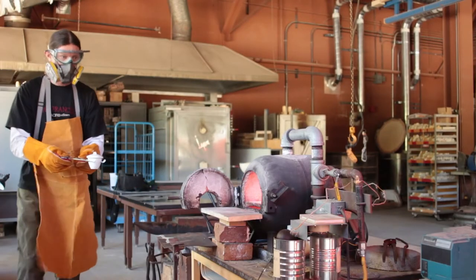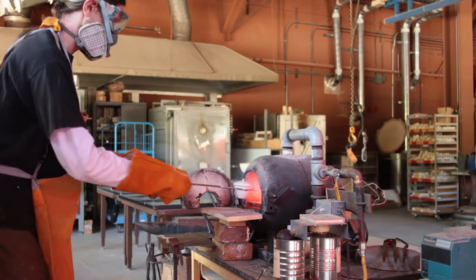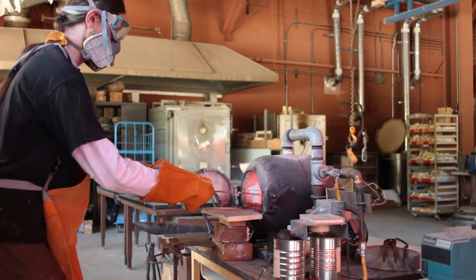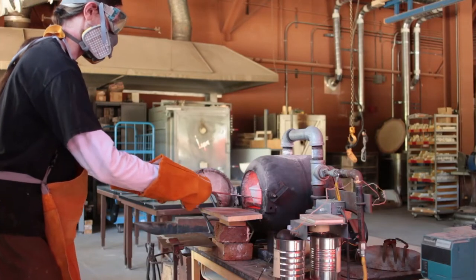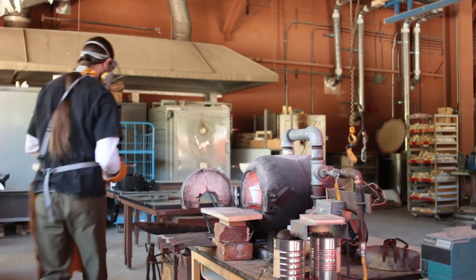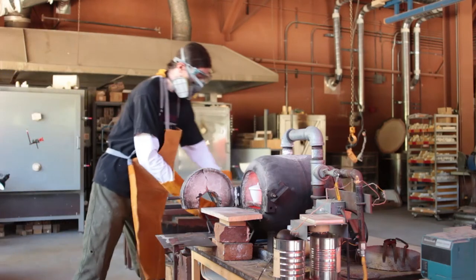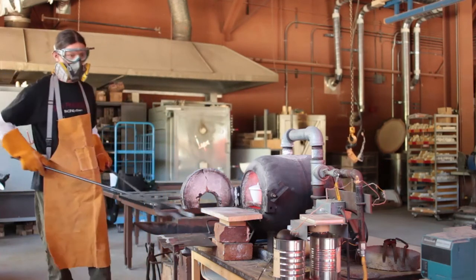While loading the crucibles into the furnace, it was necessary to wear a respirator with acid gas cartridges to protect against sulfur oxides generated during the first stage of this process. In some instances the sulfur fumes were pretty substantial, but this is a very well-ventilated workplace since it's also used for metal casting and firing kilns.